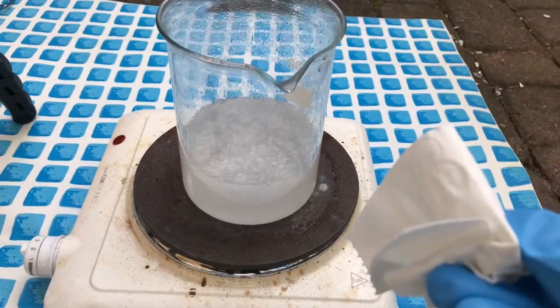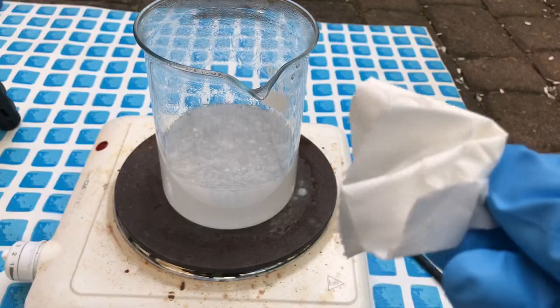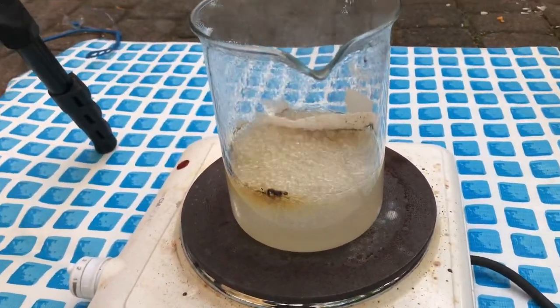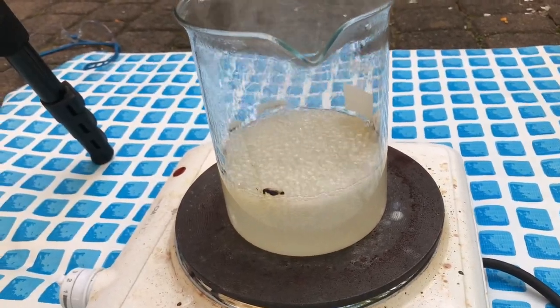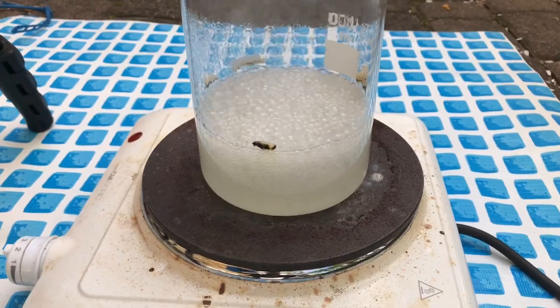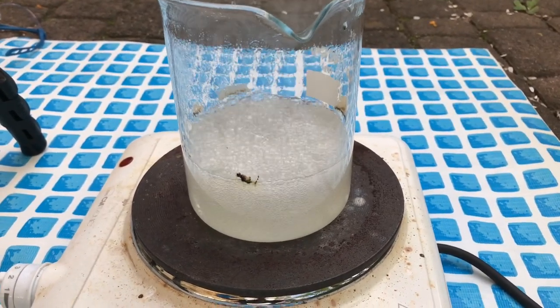Before all of the hydrogen peroxide decomposes, we are also going to add in some toilet paper. This time the reaction is more violent and you can see it decompose into a clear solution. This is why piranha solution is also used to clean organic residue from glassware.